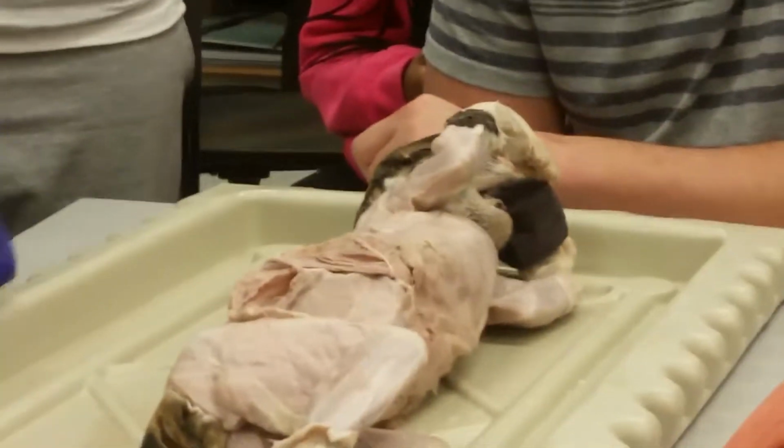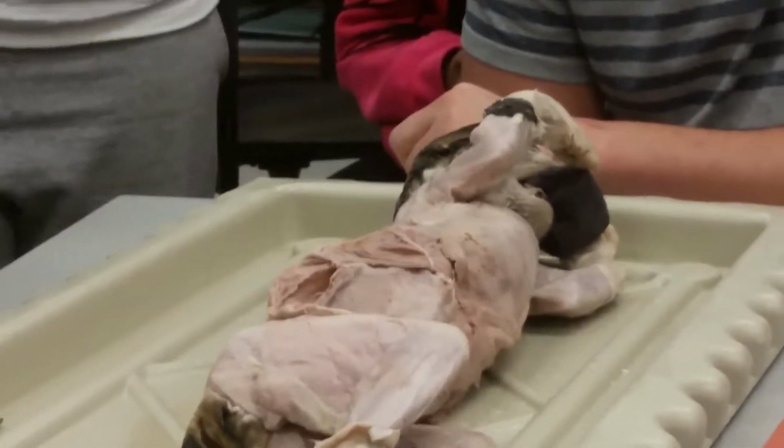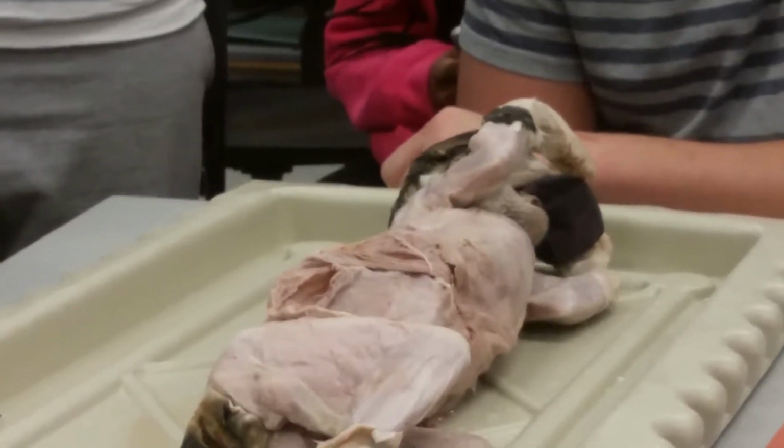This blade's dull. I can't take you serious with this mask.